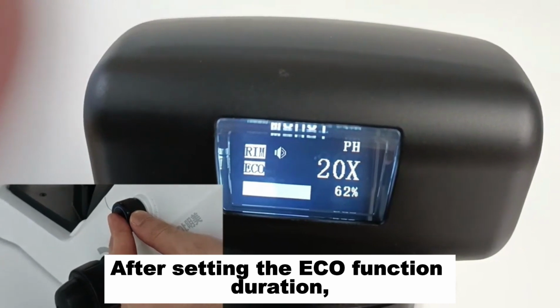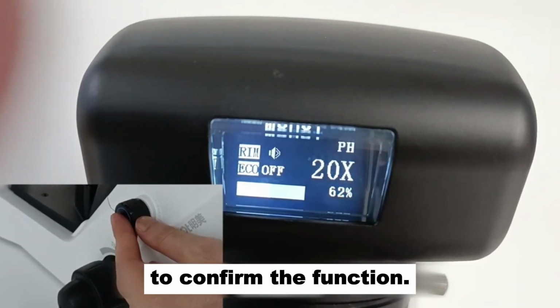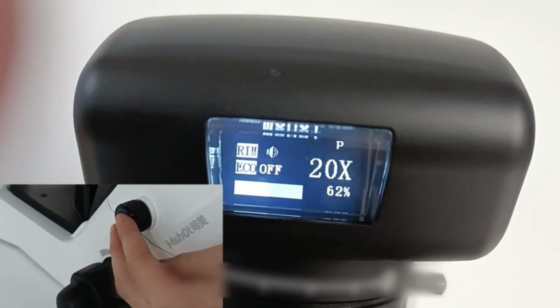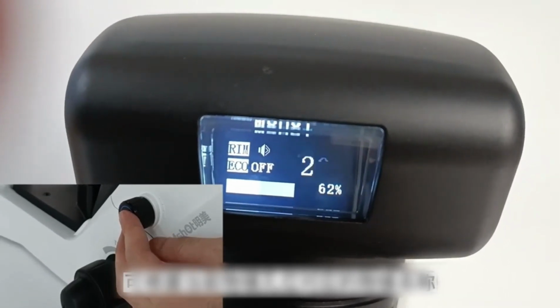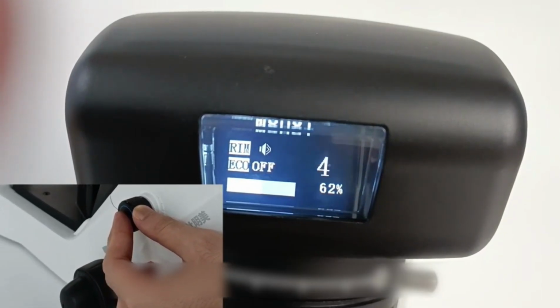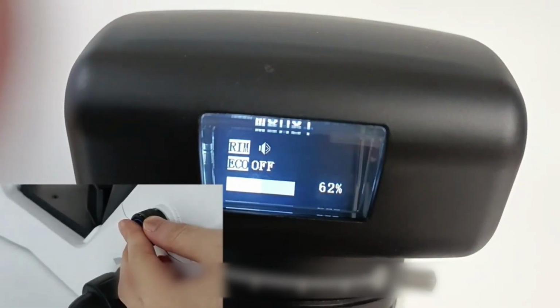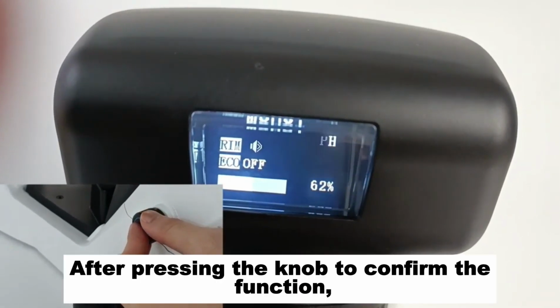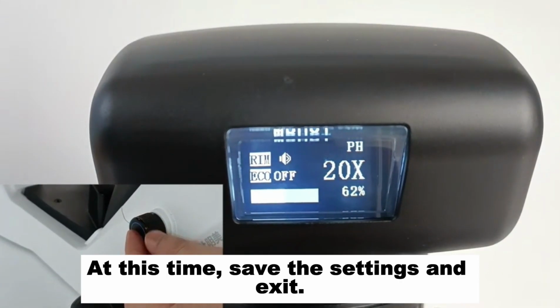After setting the Eco function duration, shortly press the knob to confirm the function and enter the objective turret hole name setting. According to the objective lens name corresponding to the hole, rotate the knob to select the corresponding name. After pressing the knob to confirm the function, the settings are saved and you exit.